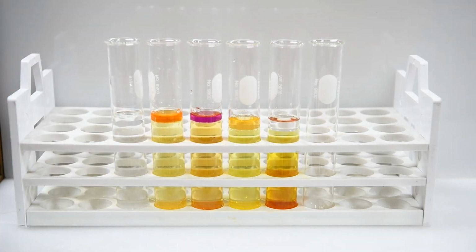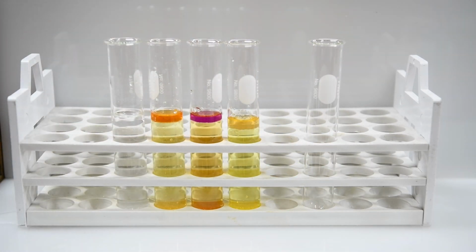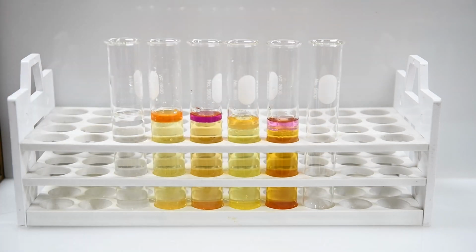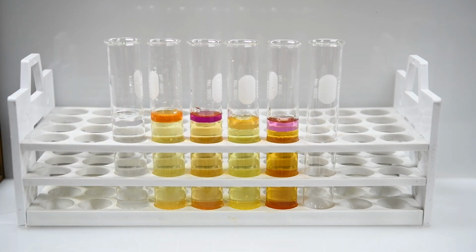And now I'll just take that off for a moment just to mix it up a little bit so we can see the color a little clearer. And now you can see that lovely violet color up on the top, and that's telling us that iodine is being produced in this reaction, because it looks pretty much the same as our sample of pure iodine in the third test tube.